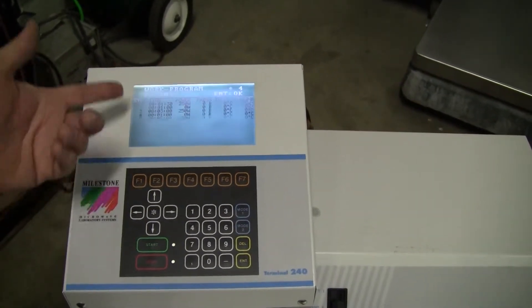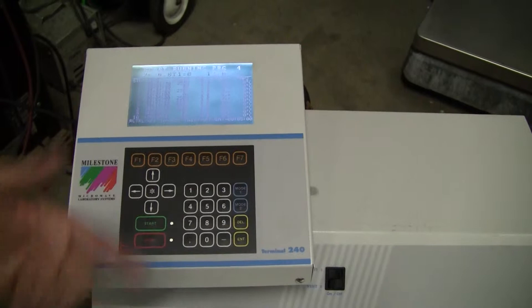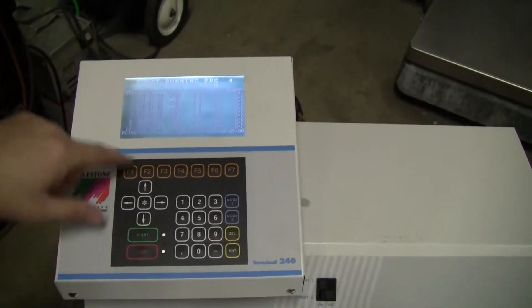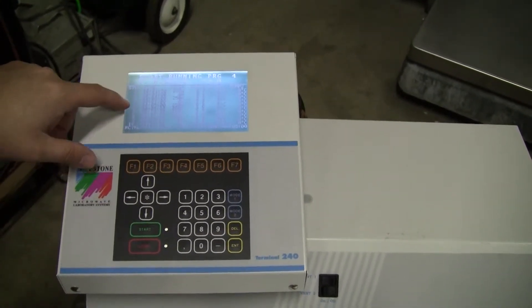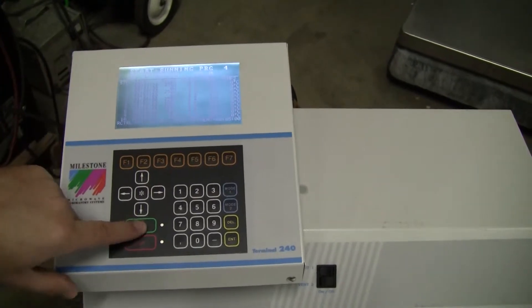Okay, F1 work. I like program 4. I don't know why, but we'll just do that. I'll hit start. Program 4, step 1 is 250 watts.